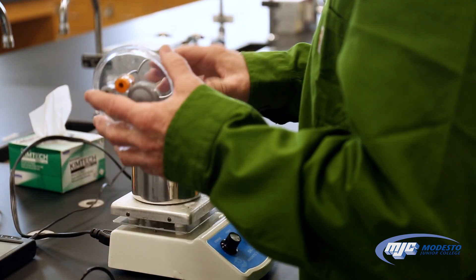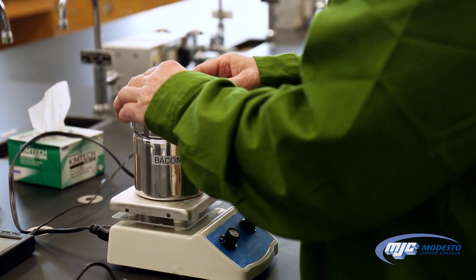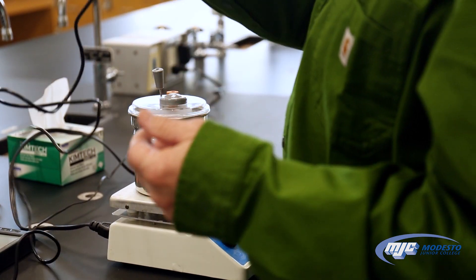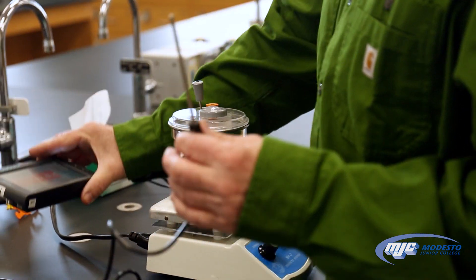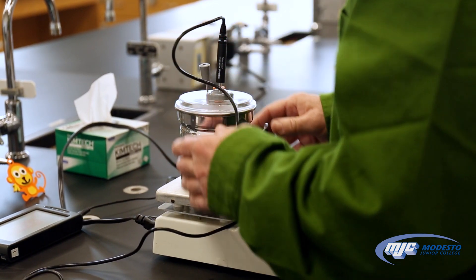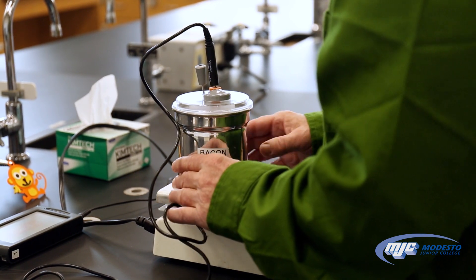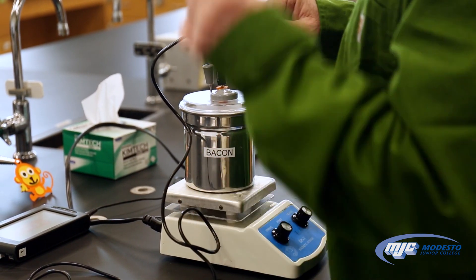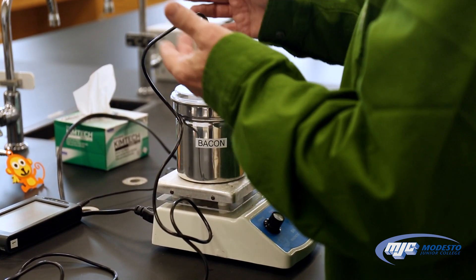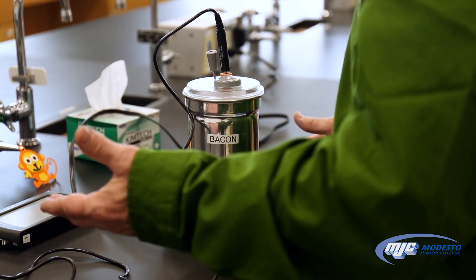I have a solution in there and a magnetic stir bar inside, and this is on a stir plate. Usually to measure the temperature, we're going to use a temperature probe connected to a LabQuest, and the temperature probe will go in here. To stir it, just turn on the stir plate and make sure that the magnetic stir bar is spinning and not hitting any of the things in here — the temperature probe or the other stirrer. And now we're ready to take our measurements.